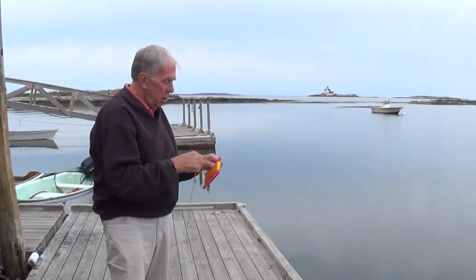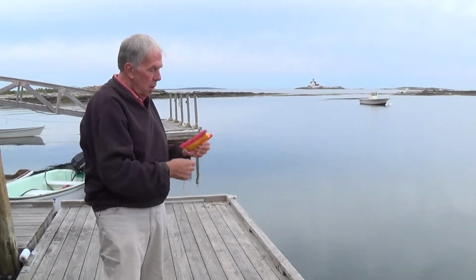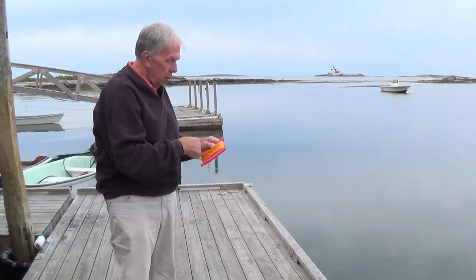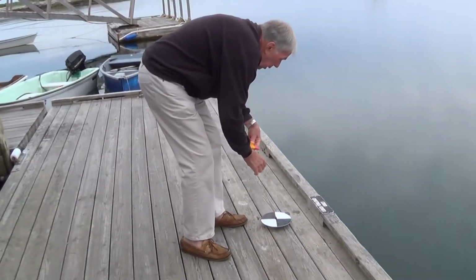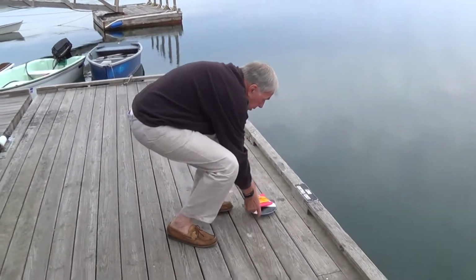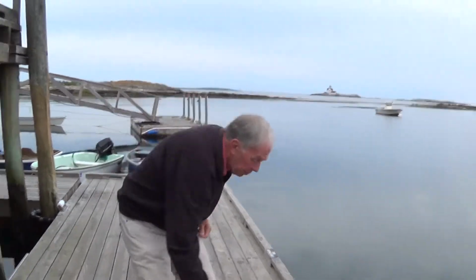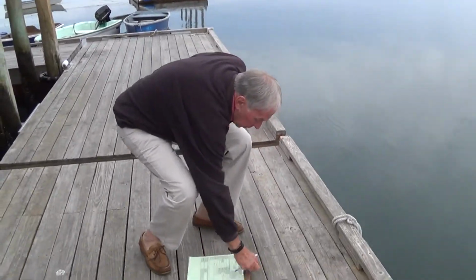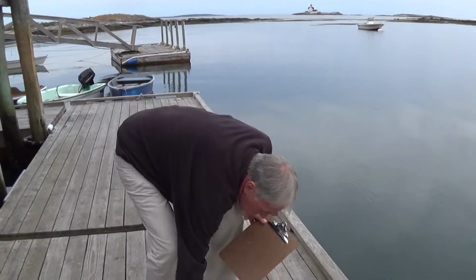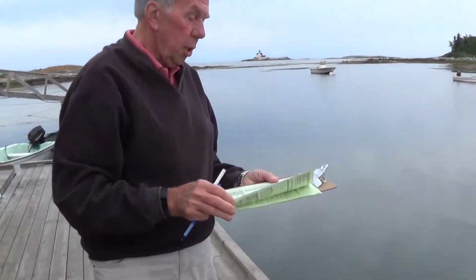And while I do this, on the back of that sheet that I was making recordings, observations rather, is an indication for that measurement. So if you can get a shot of this.